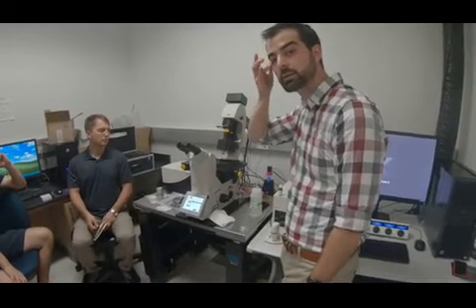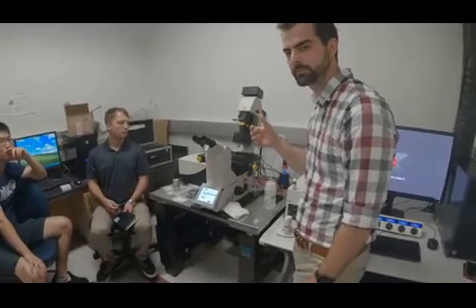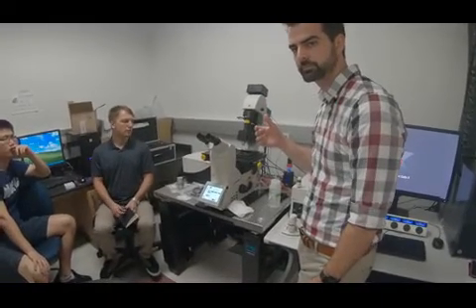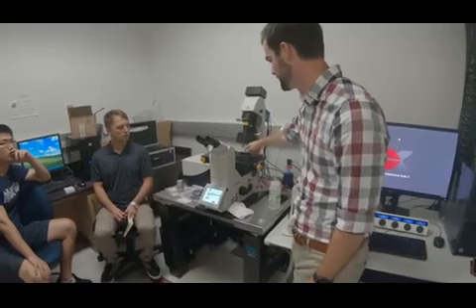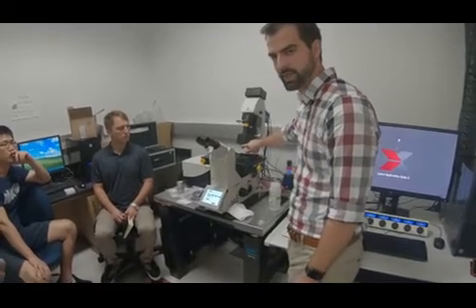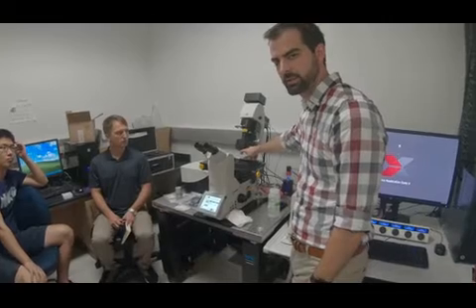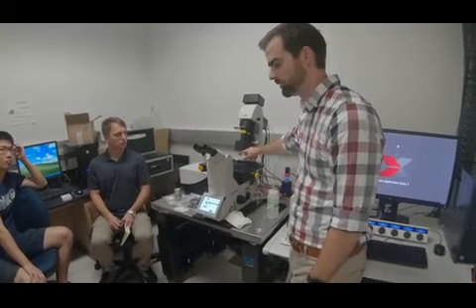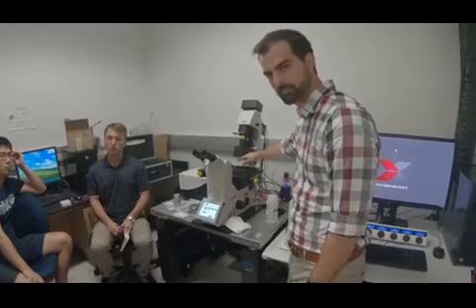My question is because for regular microscopy, you have numerical apertures defined for a particular objective. Right, so the resolution of your image is dependent upon the detection objective. There's a 5, a 10, and a 25x detection objective, and they each have their own numerical aperture. Okay, so it can change.